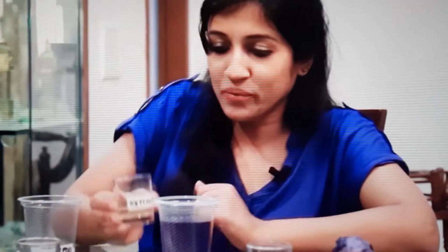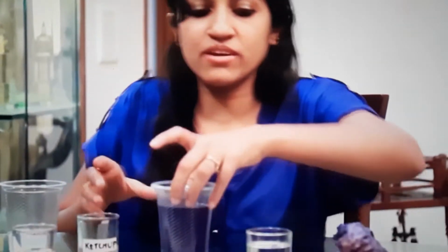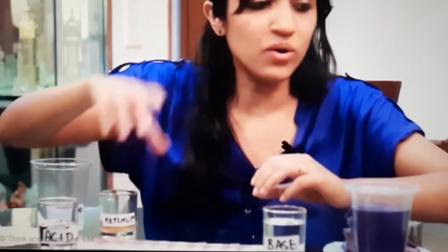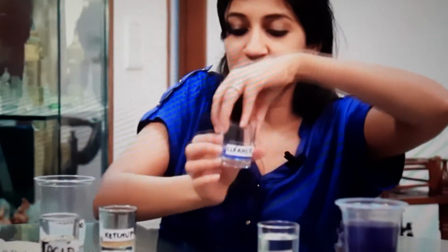Some sauce, please. Ketchup. Okay. And I need a solution of this, please. Thank you. Let me keep my indicator out here on the side so you guys can see this better. What next? Some toilet cleaner, maybe? Can I have a solution of this, please? Thank you. Wow. That's a lovely blue.